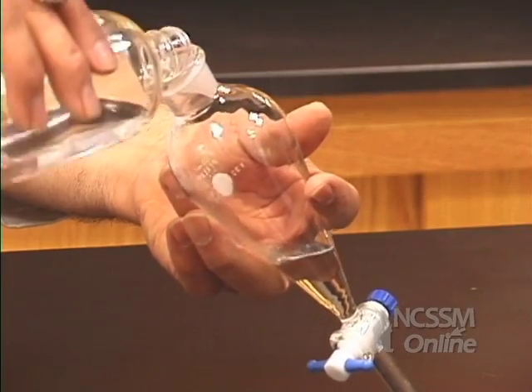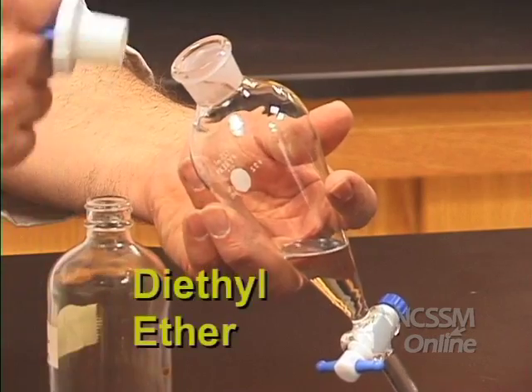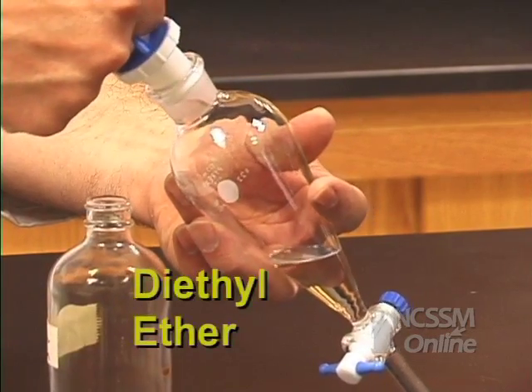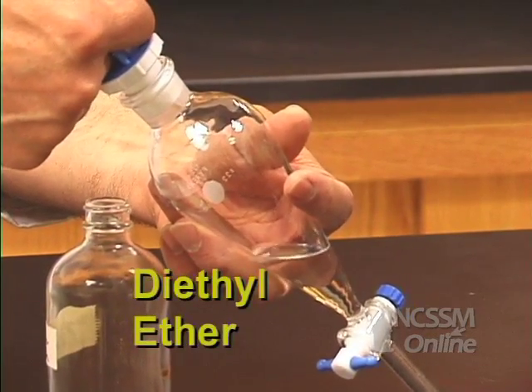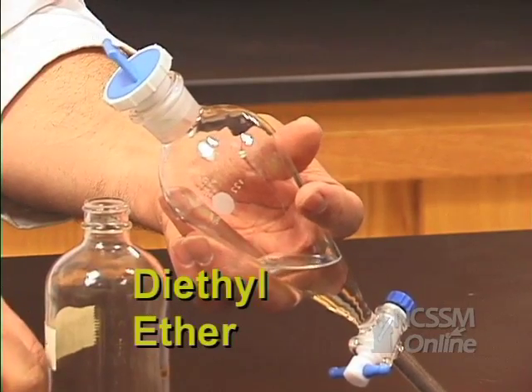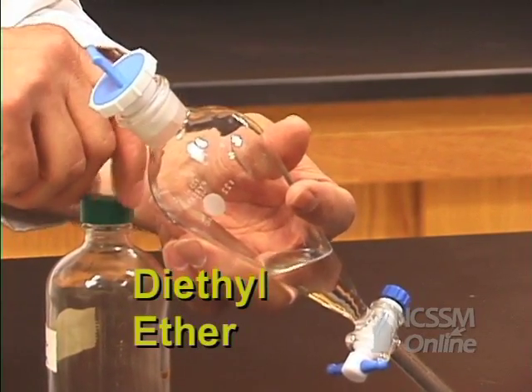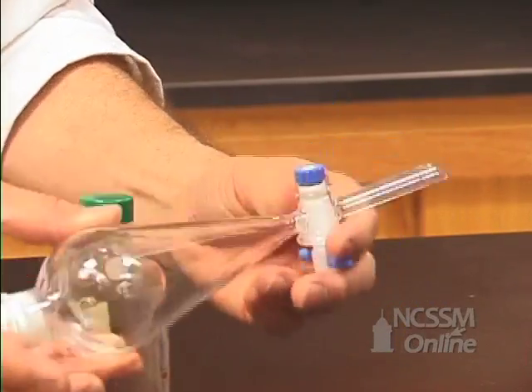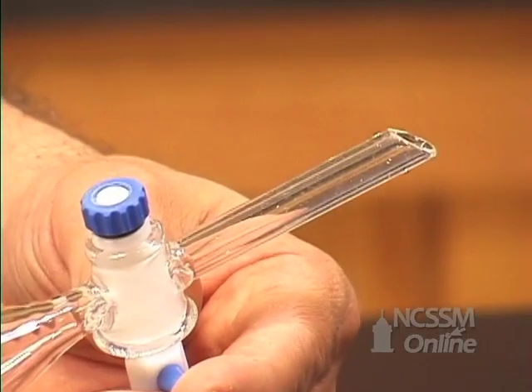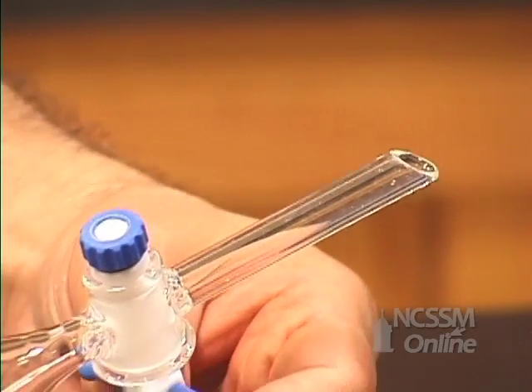We are going to place some ethyl ether, which is a low boiling liquid — it boils at about 36 degrees Celsius — into the separatory funnel. We shake the separatory funnel and we open the valve and observe the results.